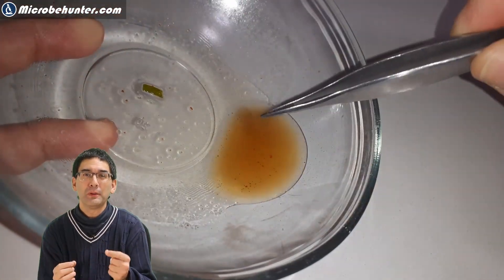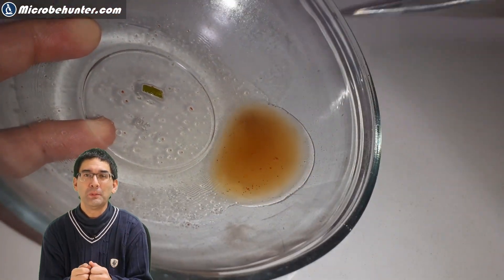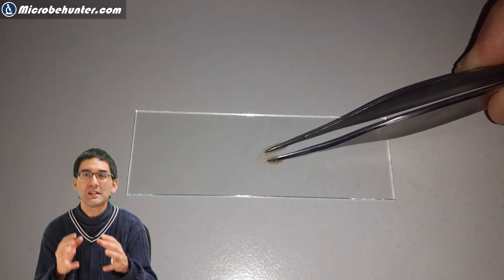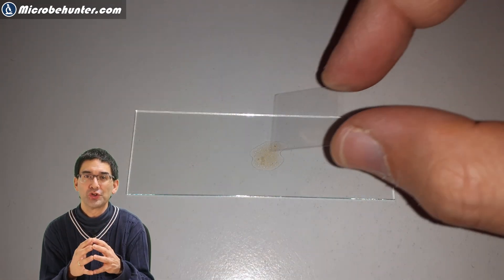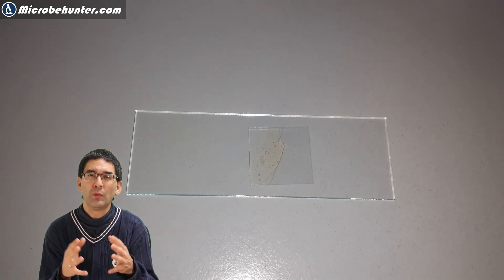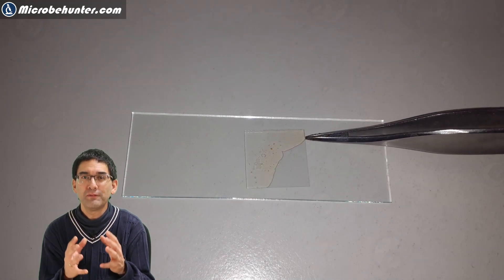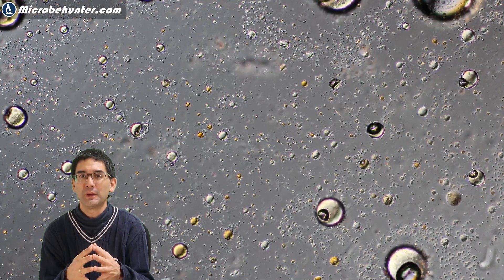When you put a drop of the soup under the microscope, then you are able to see countless perfectly round structures, even of different color. And now what are these round things?